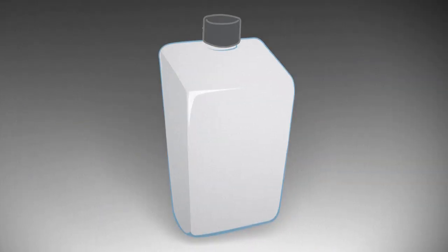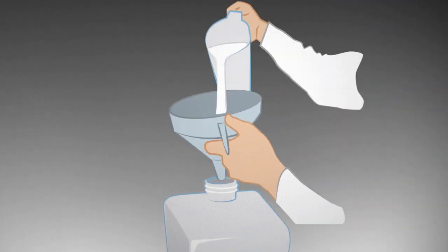In a large glass or plastic bottle with a lid or screw cap to allow mixing, pour in the alcohol.